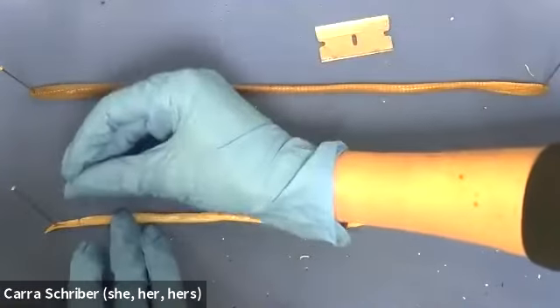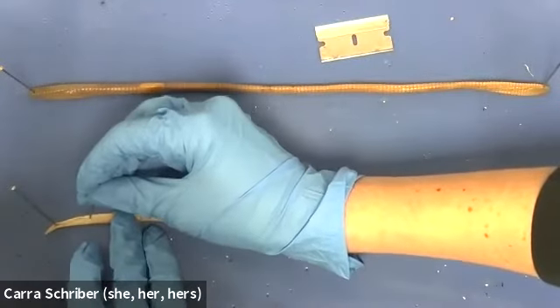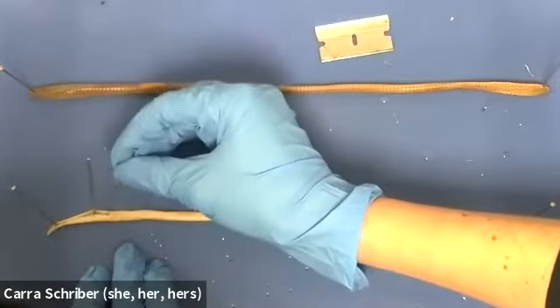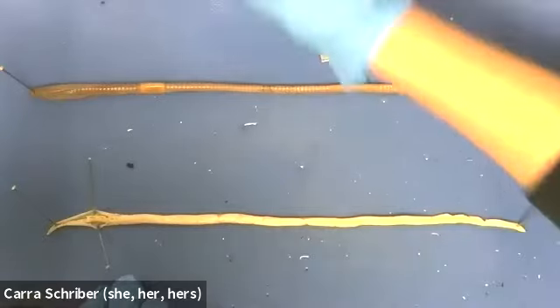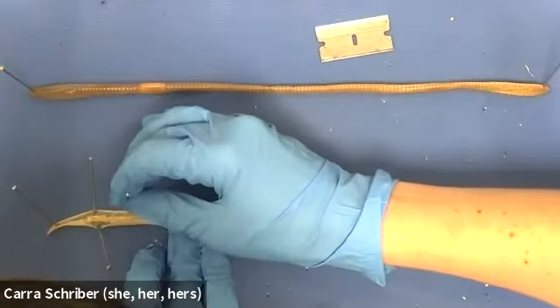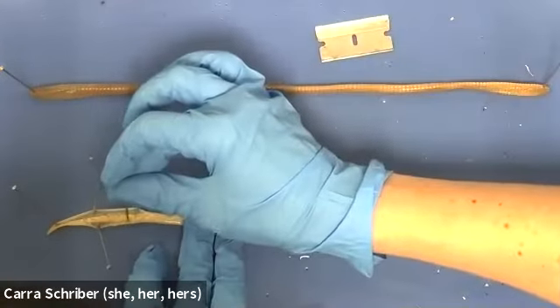Let's take a look here. So then open this up and we'll pin it. We'll pin the skin back on both sides to expose the internal organs. All right. Moving down here. You can see that this is peeling away pretty easily.